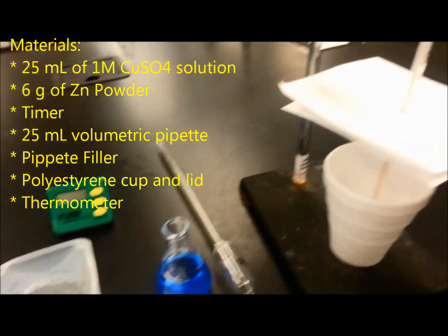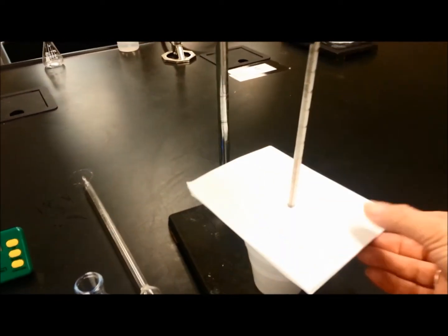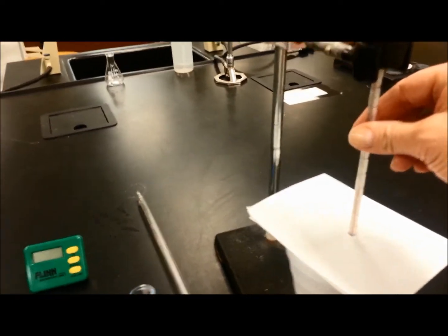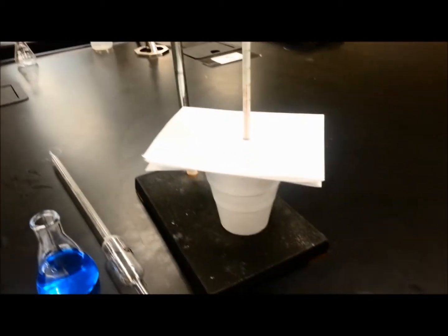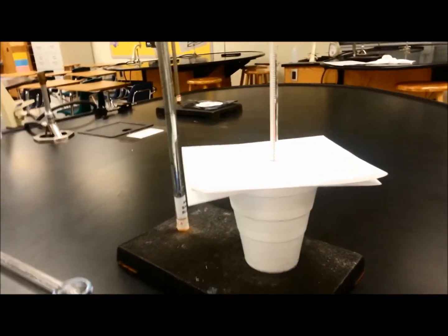We need a styrofoam cup, lid of any kind, and a thermometer that we attached here so we can move the styrofoam cup in the meantime while the reaction takes place.